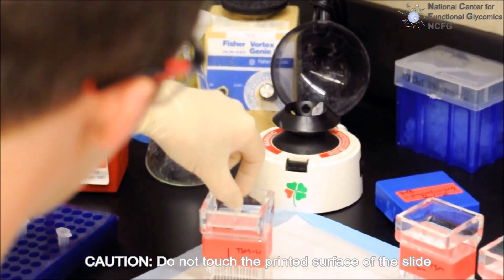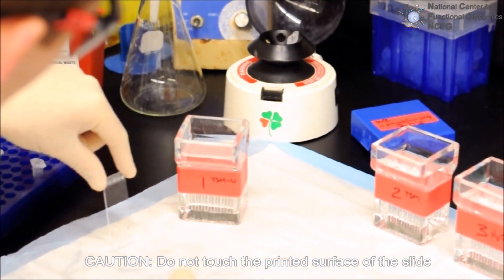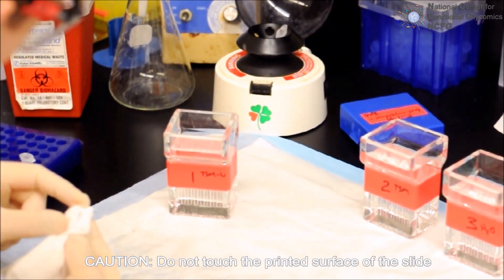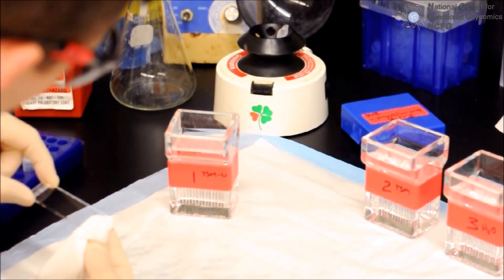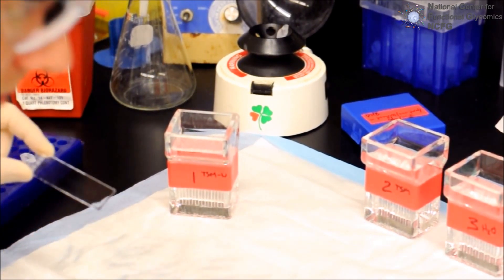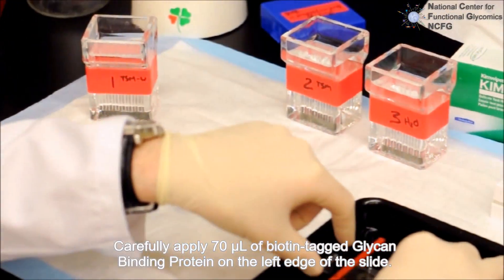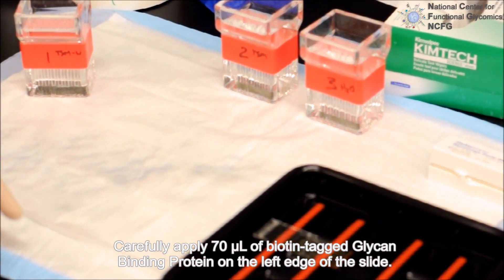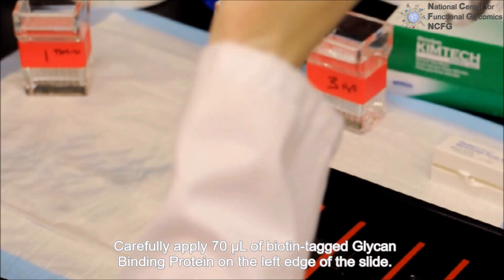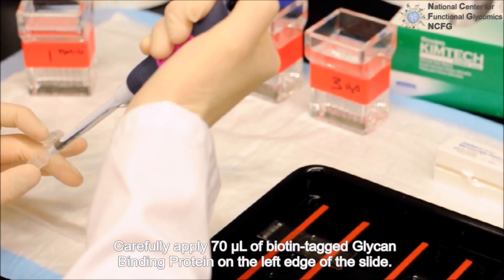Use caution, do not touch the printed surface of the slide. Carefully apply 70 microliters of the dilution of lowest concentration onto the slide, one quarter of the distance from the left edge.